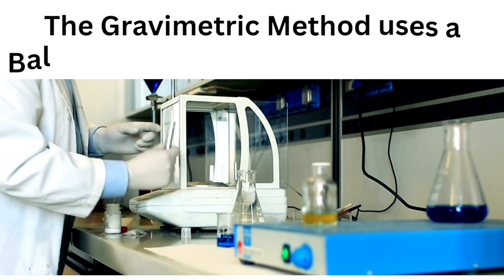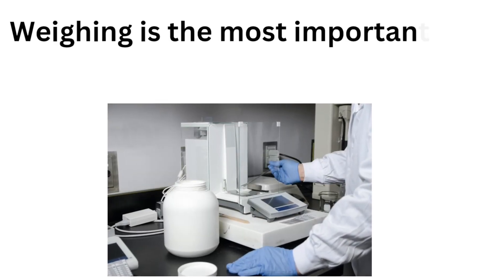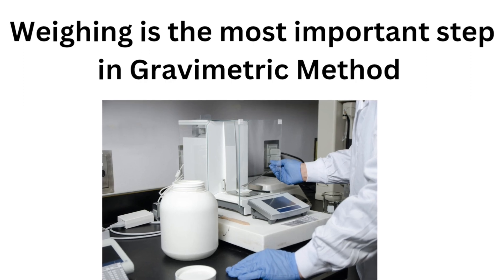The gravimetric method uses a balance to weigh the liquid volumes. Weighing is the most important step in gravimetric method.